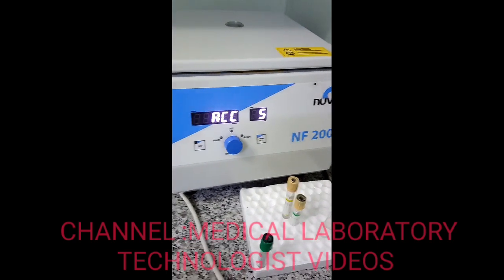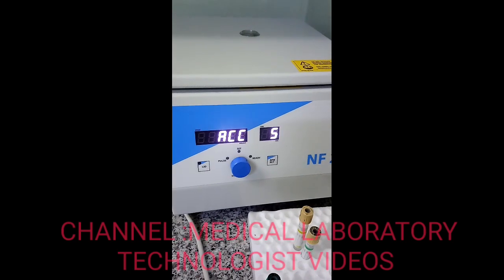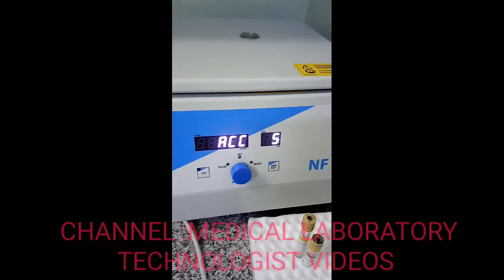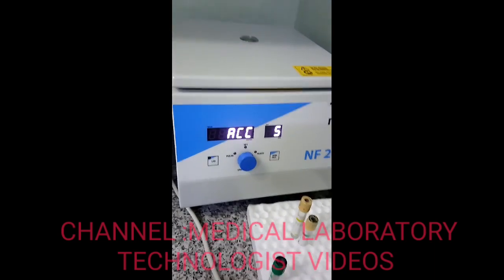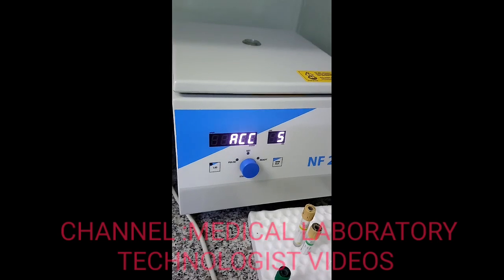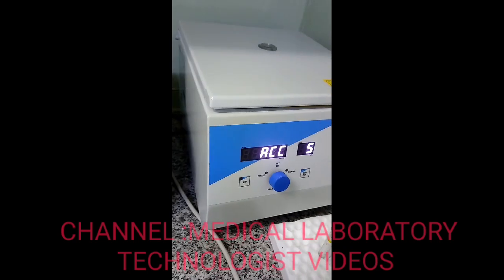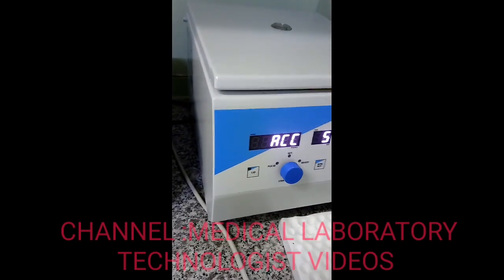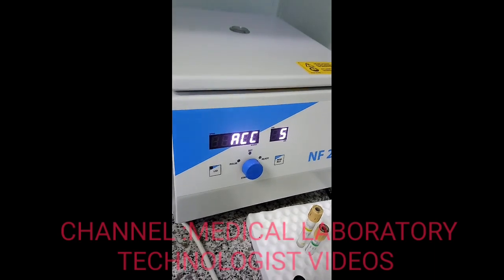For small clinic level, I recommend this is an ideal centrifuge — very easy to use and very good results. We will now wait for five minutes and see how the serum is separated. If you feel the serum is not clearly separated or there are still fibrin clots, just do one more centrifugation and check your results.